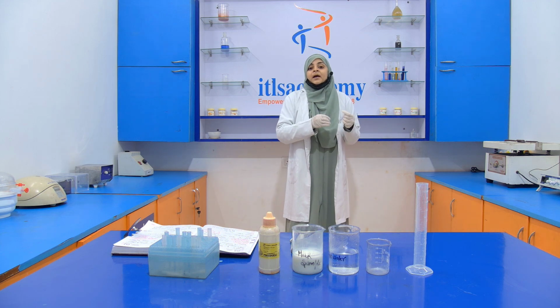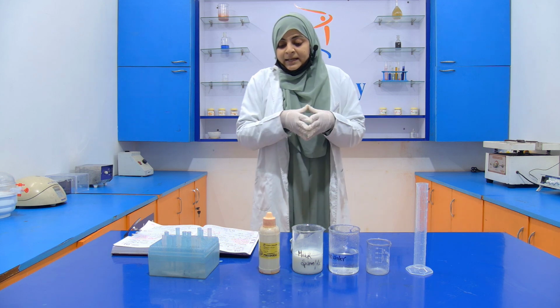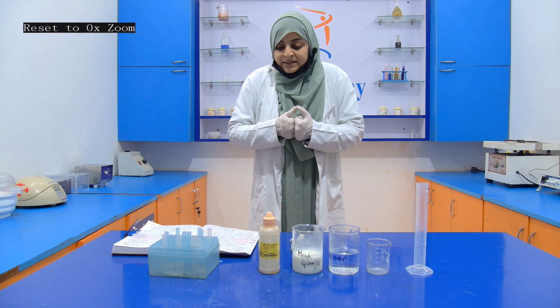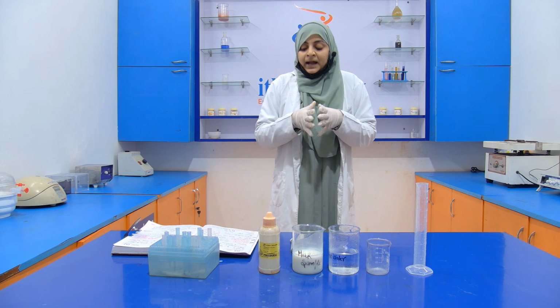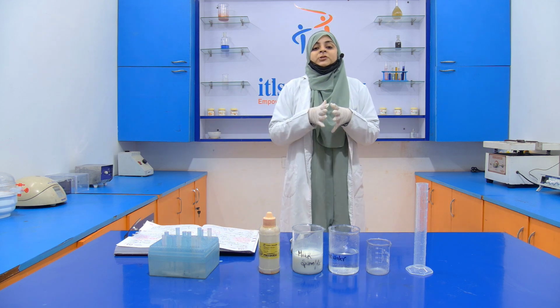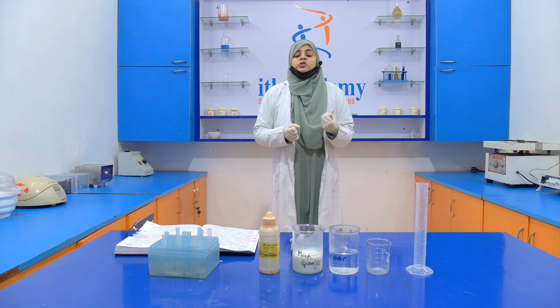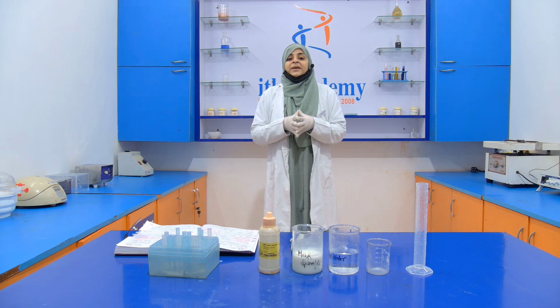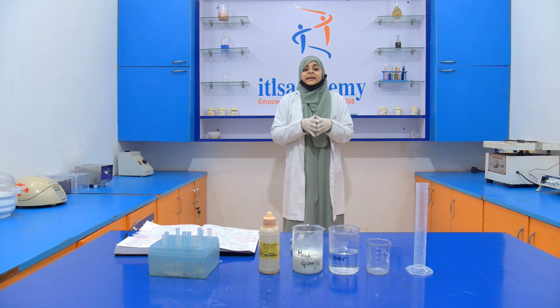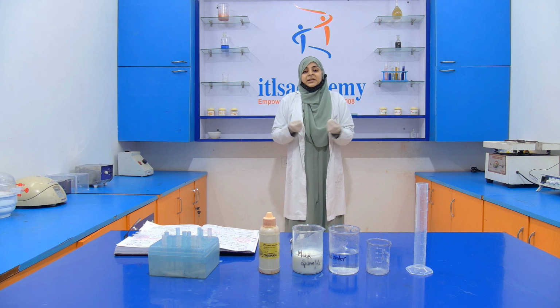Okay, so here pulverized soap is added into the milk so that the thickness of the milk increases, the creaminess of the milk increases, and it does not show the addition of the water. So ultimately the reason behind the addition of this pulverized soap into the milk is to increase the thickness or the creaminess of the milk.